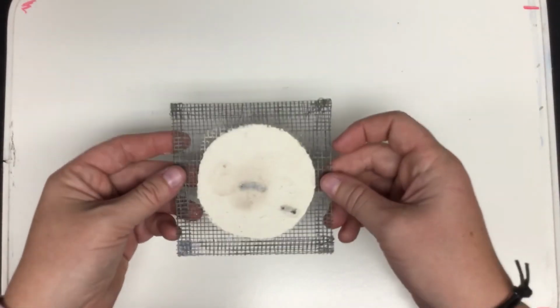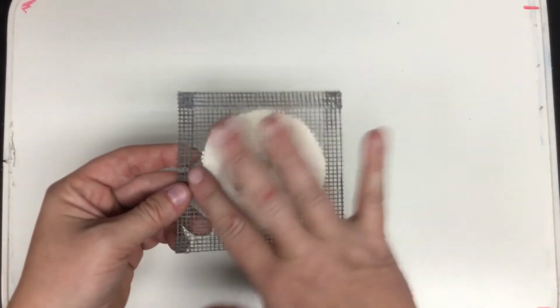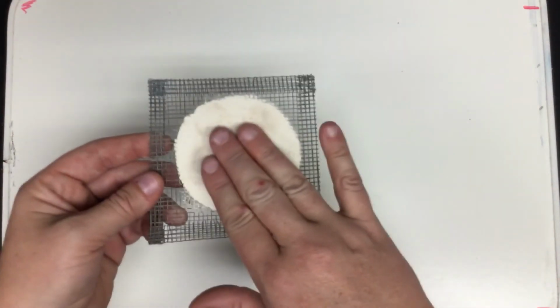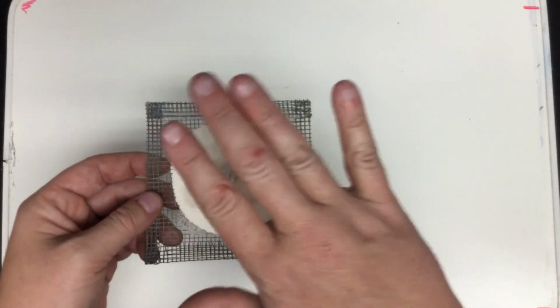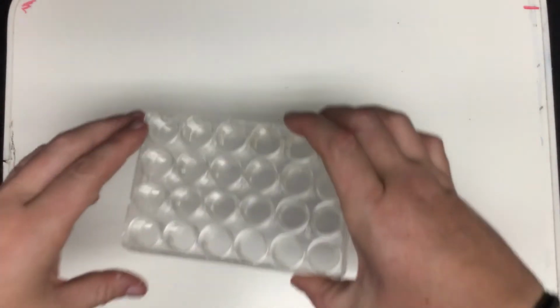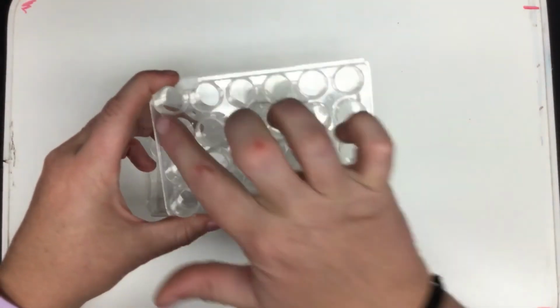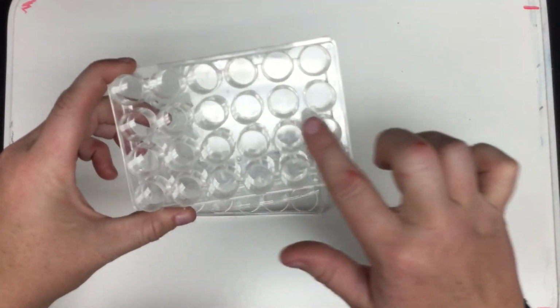This is our wire gauze, and wire gauze is used to protect the actual lab table. It has this ceramic covering in the middle that can absorb an incredible amount of heat. So if you have something like a beaker that you just took off of a hot plate, you would want to put it on your wire gauze before transferring it anywhere else. We have our well plate that just has all of these little plastic areas that you can perform micro experiments in.